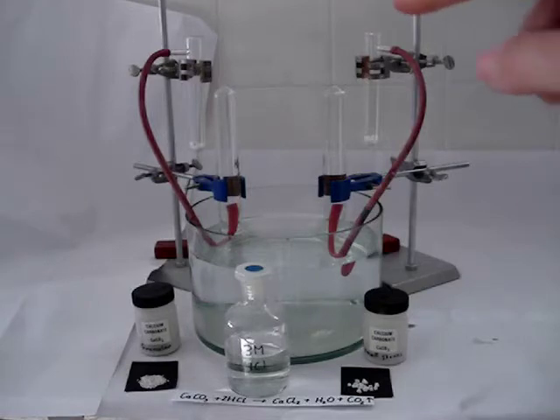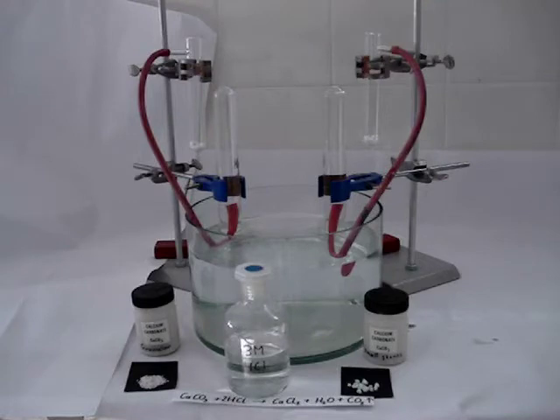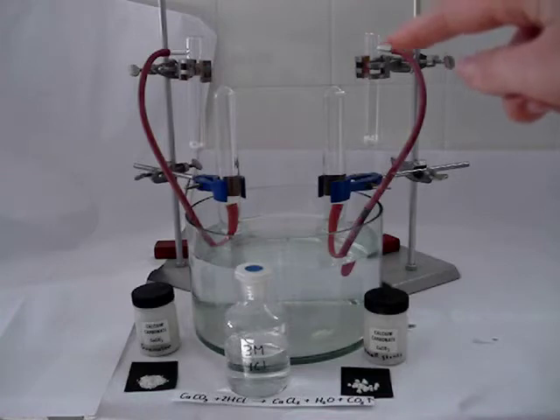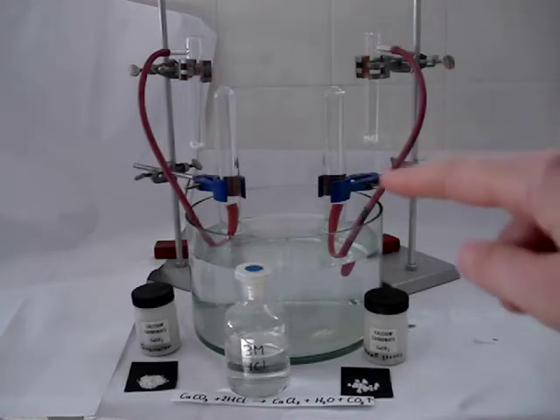Shortly, we will add some hydrochloric acid to each of the test tubes, and that will cause this reaction given below, forming carbon dioxide gas. This carbon dioxide gas will rise and travel along this delivery tube in each case.